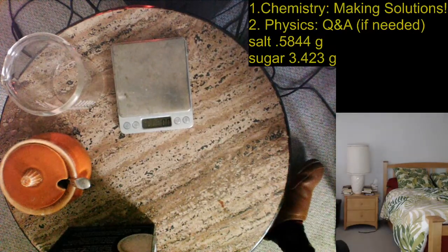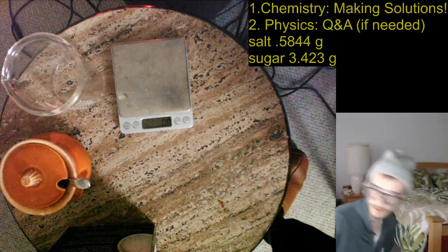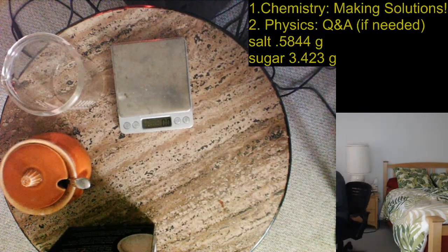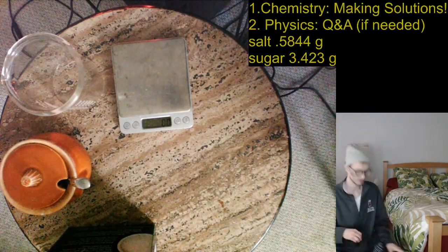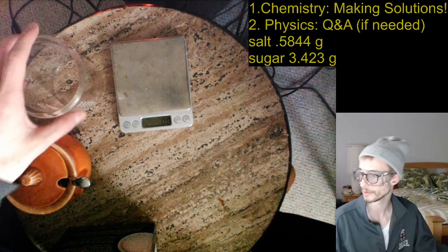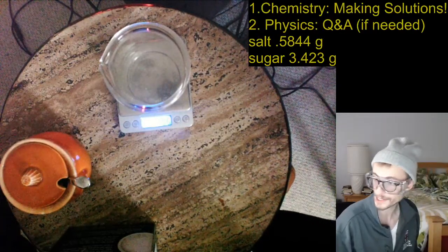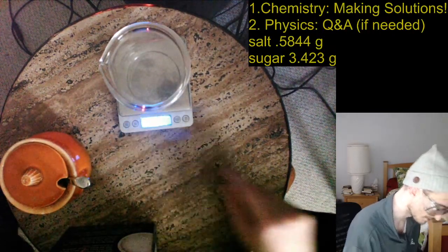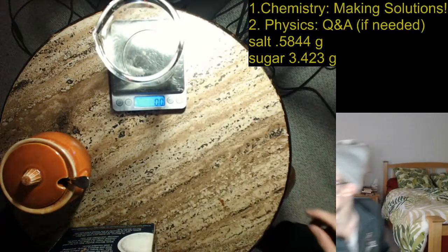Okay, I had a little weigh boat and then I lost it. Let me figure out where I put that before I carry on. Uh-oh. I need something to put this on so I don't put it directly on the scale. Well, I actually could just use the beaker. That's not the worst thing in the world. I'm not sure you're going to be able to see it as well, though. So I can put the beaker on here and it's going to give me some mass, but I'm going to get rid of that by taring the scale. Again, I'm not sure you can see because the scale is kind of light. Maybe I'll turn on the lamp. I don't know if that's any better. Oh yeah, you can see it, so 0.